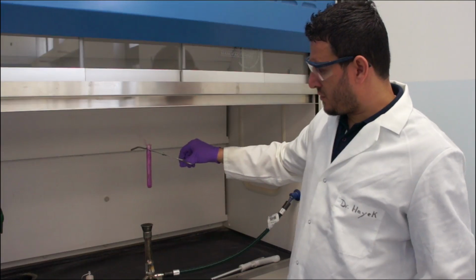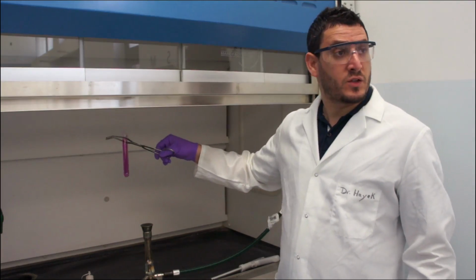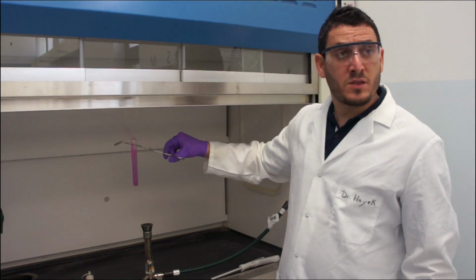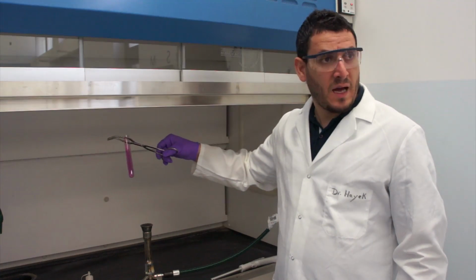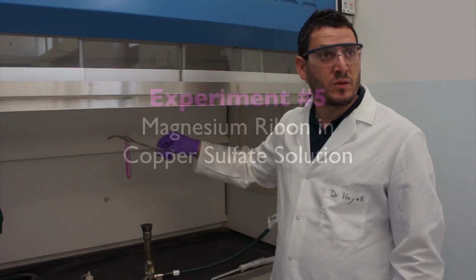Once you make sure that all the iodine solid was converted to vapor, you just let it sit. What is going to happen after a certain time? The tube will become empty because all the iodine vapor will escape.